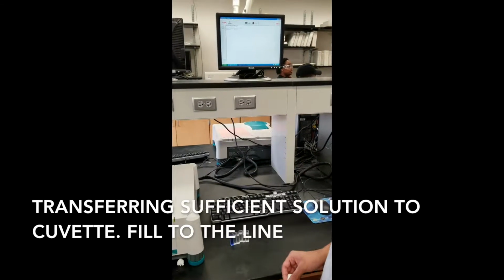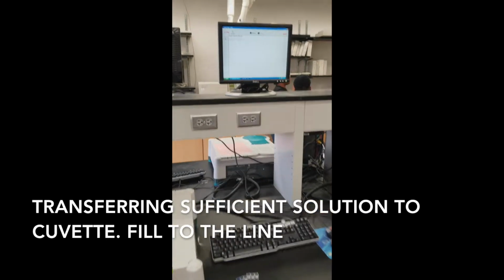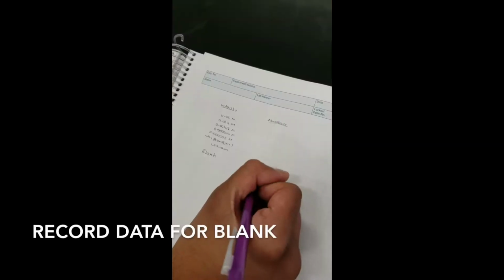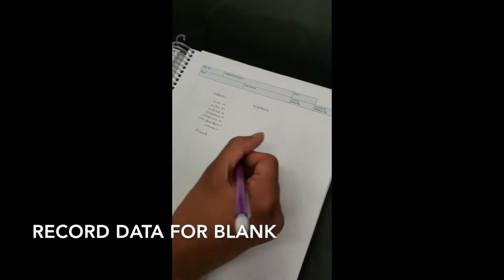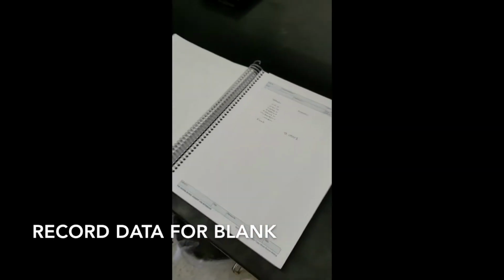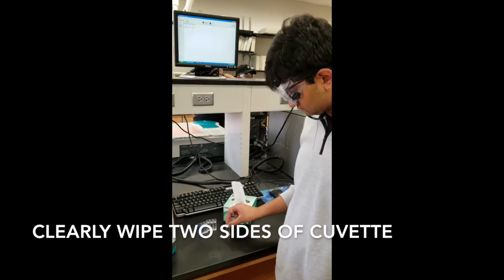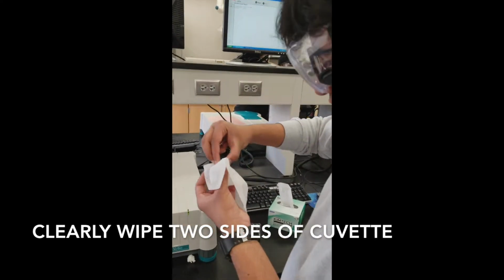He's going to confirm that the spectrophotometer has been zeroed. So now the spectrophotometer has been zeroed. This is a blank solution, which is shown to be 0.0003. So first, Hemant is going to carefully wipe the two sides of the cuvette and make sure that they are clean.